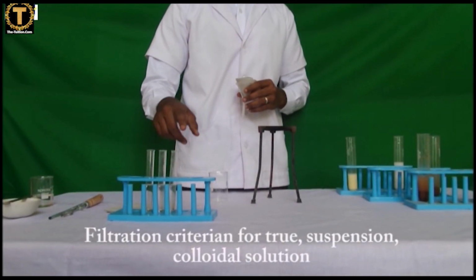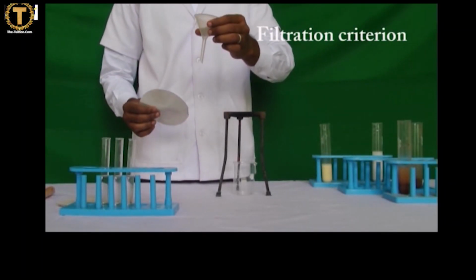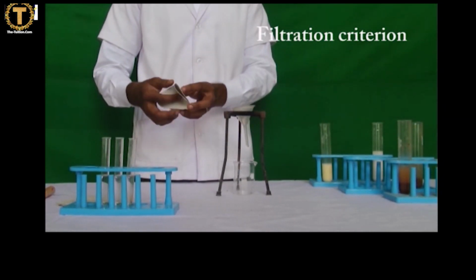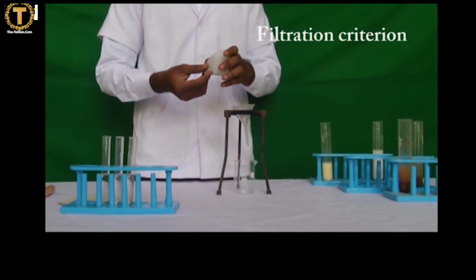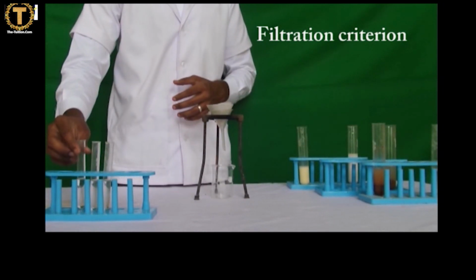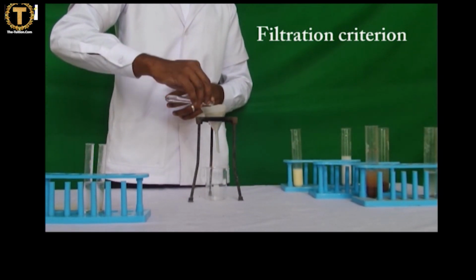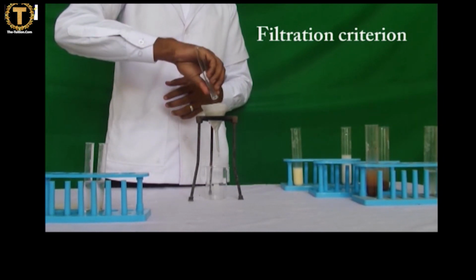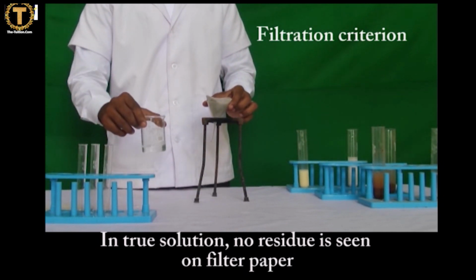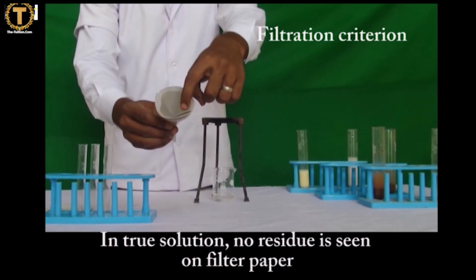To check filtration criterion, take a tripod stand, place a funnel over the tripod stand. Fix the filter paper in the funnel and check for the filtration criterion. Record your observation.